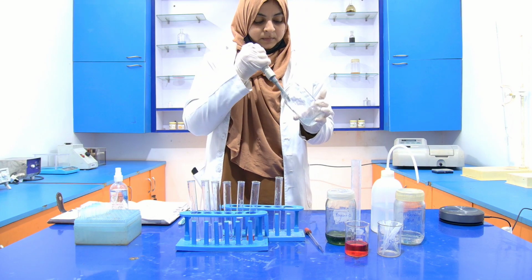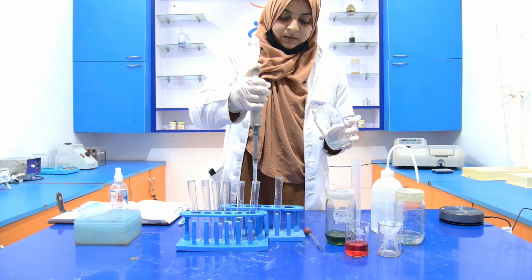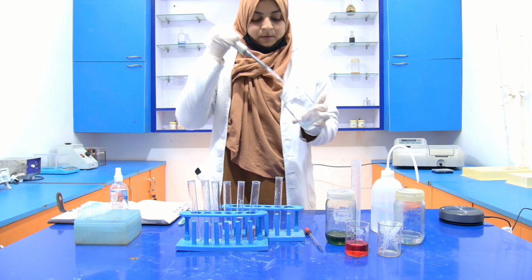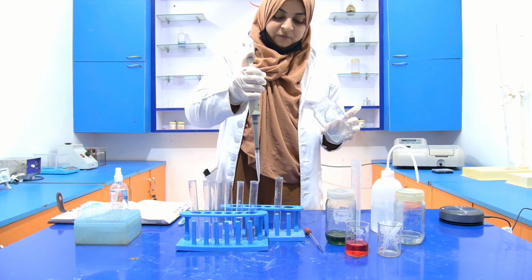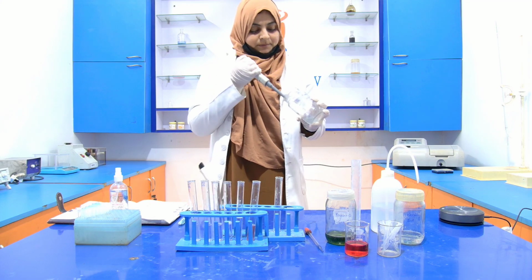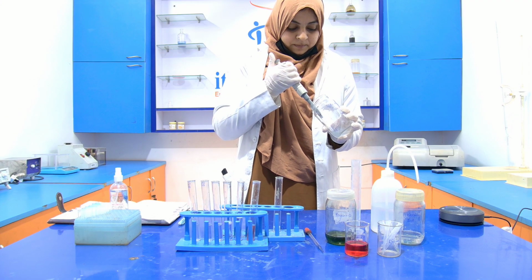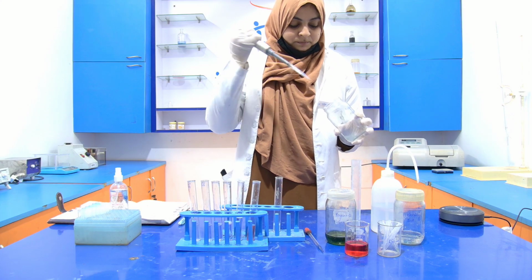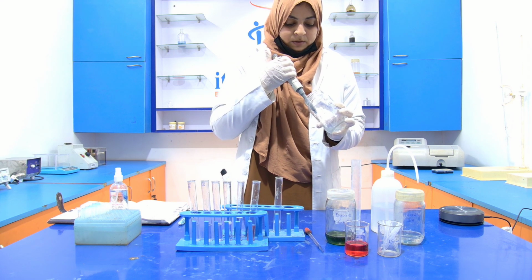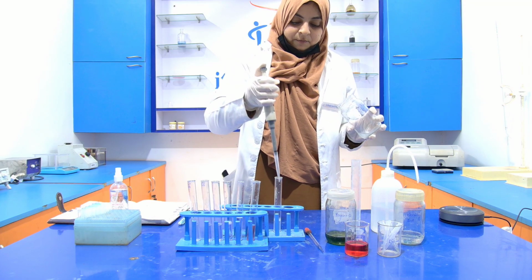1, 2, 3, 4, and 5. And we also have to add 5 ml into the blank one. 1, 2, 3, 4, and 5.